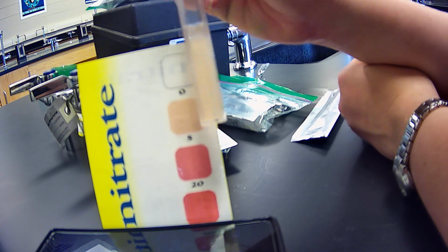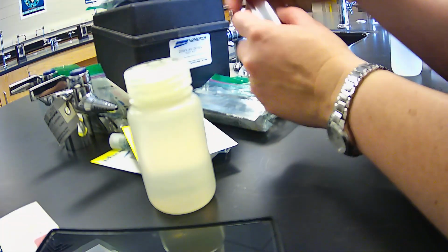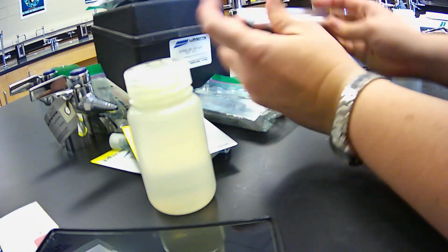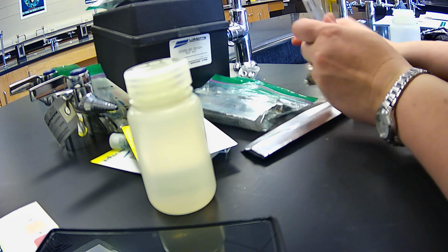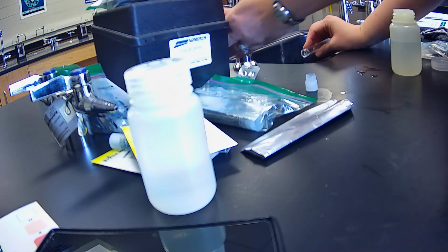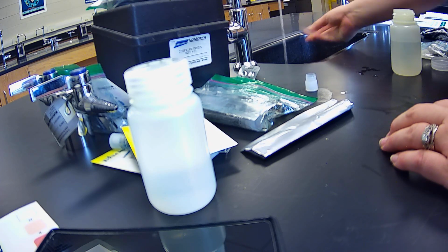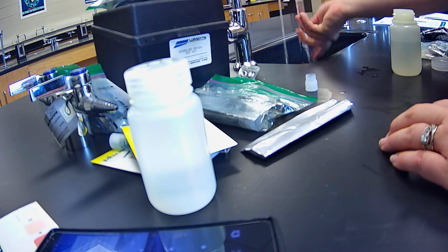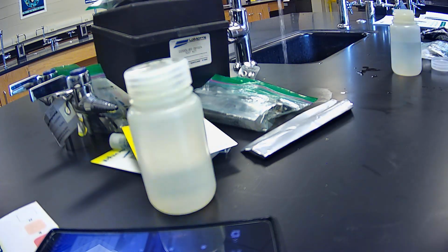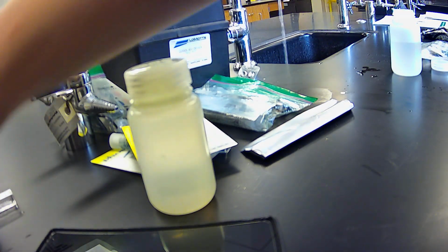All right. Well, if you've got that calculation, note that it says that below 4 is unpolluted waters, with above 4 contributing to some pollution. Now, if we were outside in the field, you can throw this not directly into the water, but where there's a bunch of vegetation, so that the plants can absorb any of the chemicals. But we're just going to wash it down the sink with extra water, just to make sure that it isn't doing anything to our systems. Okay, so that is nitrate.